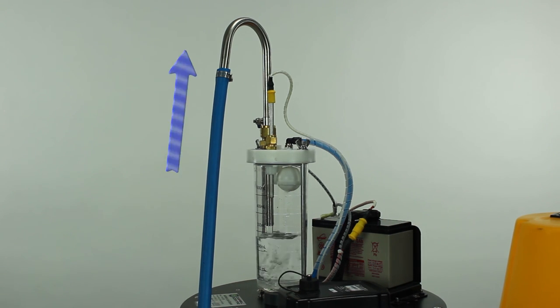We've seen the water pull in. It's going to purge out to the bottom of your volume control rod. Once it's purged, it's going to drop the sample into the water bottle inside the sampler.